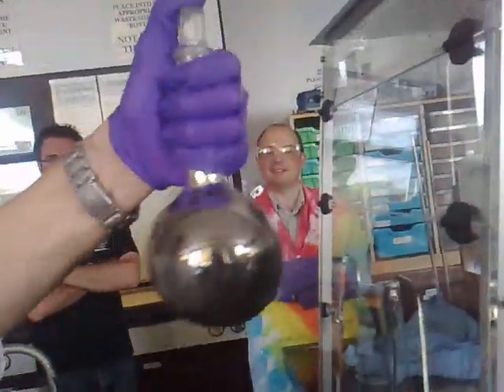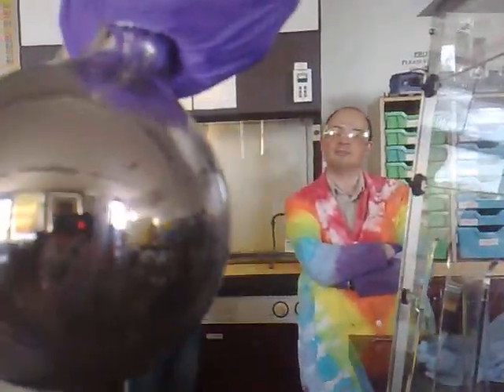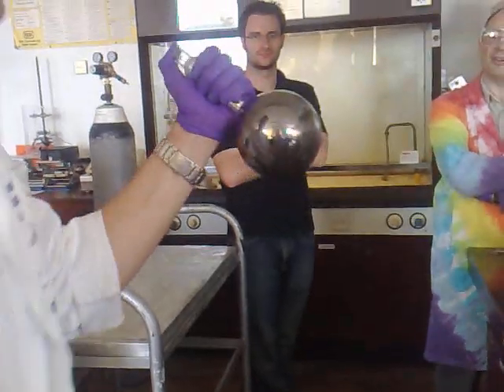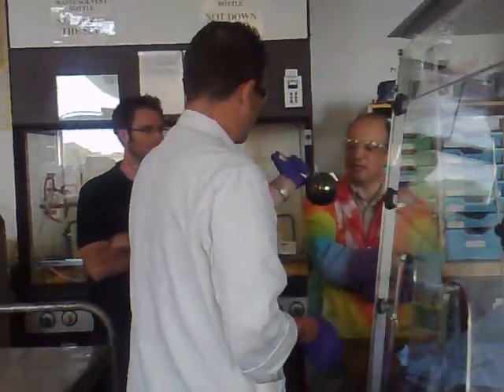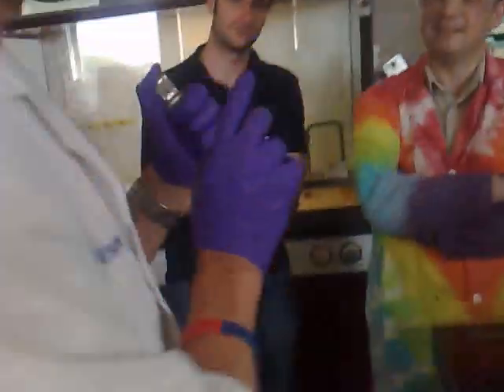I think it actually goes a little bit more silvery and shiny. Very good. We need to get a really good camera shot of you reflected in it. But we're not finished yet, because to liberate our silver — see, that's much better now, look. We need to keep on going and persevering.